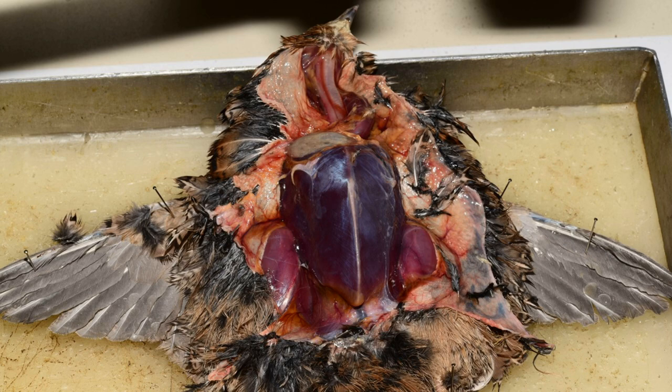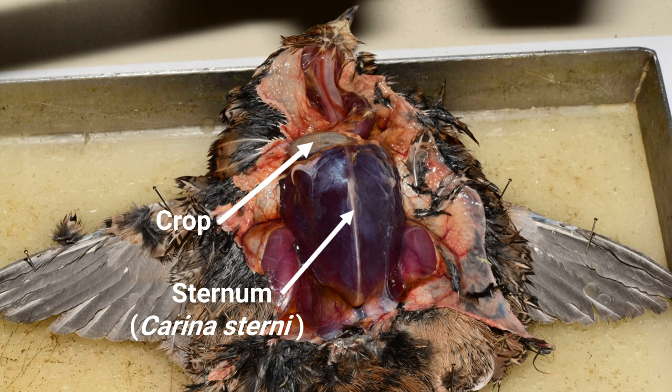The sternum of birds is very large and broad. In all flighted birds, it has an extensive crest, the carina sterni, from which the flight muscles arise.